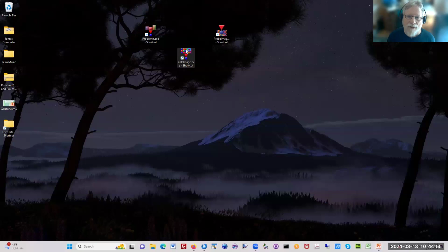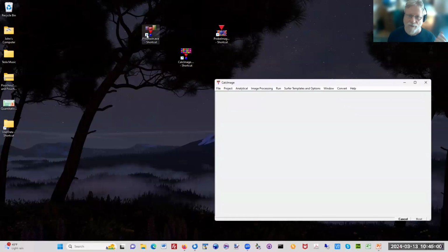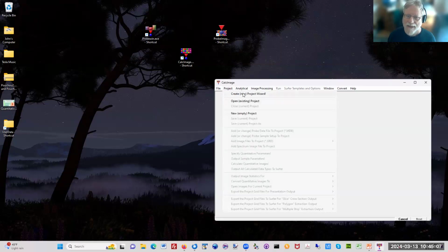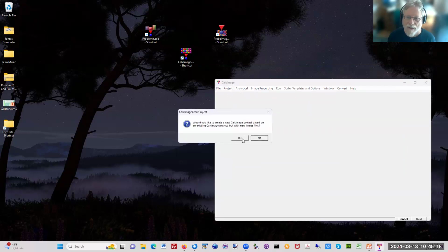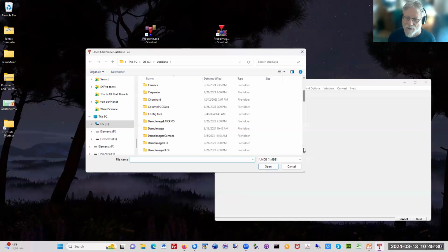So I'm going to run CalcImage here. And this is where we've now taken the sample setup from Probe for EPMA and the standard intensities from Probe for EPMA. Although I should mention there is a mode where you can create a new project. It basically just walks you through the process of creating a new project, and I can show you that it's actually very simple. We say we'd like to create a new project based on an existing project, which means you just specify new image files. Or you can say, no, I want to create a new project from scratch. And so very simply, you go find the Probe for EPMA file that you want to use.